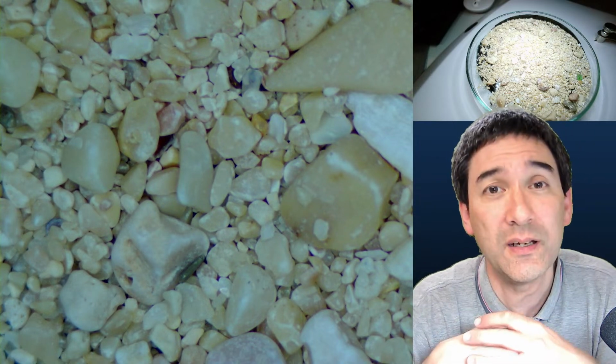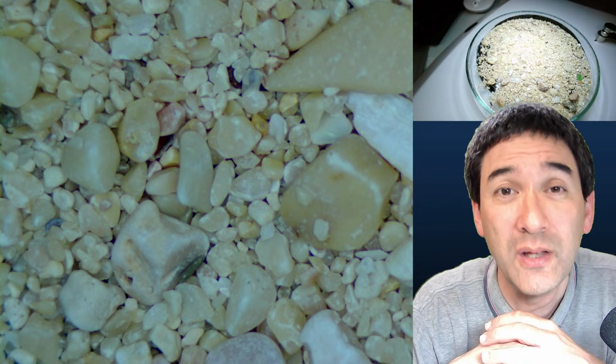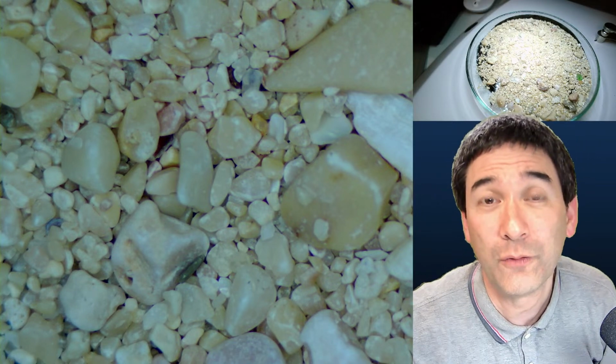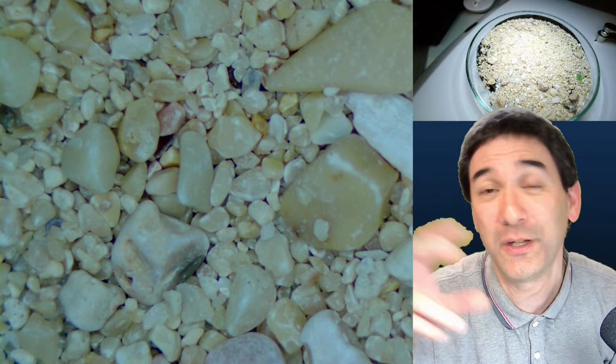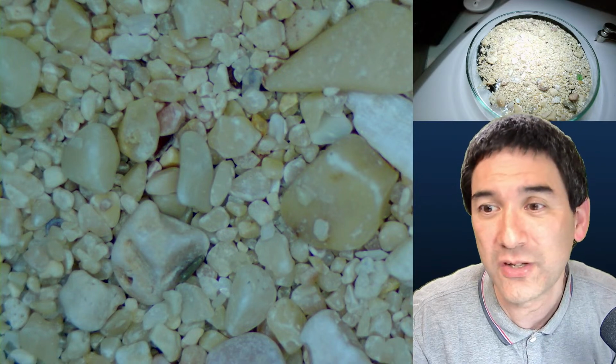For this reason, those HDMI camera solutions are also very practical if you want to do science demonstrations or a science fair, where some people are looking through a microscope, but you also would like to make it available for other people to look through. Those cheap microscope cameras are a pretty nice solution here.